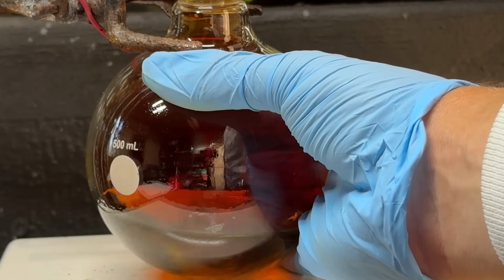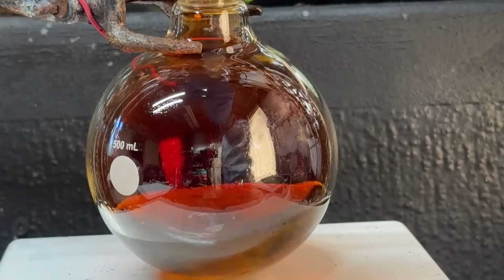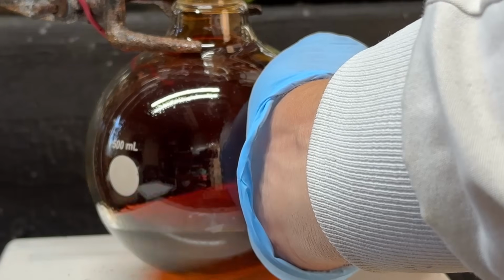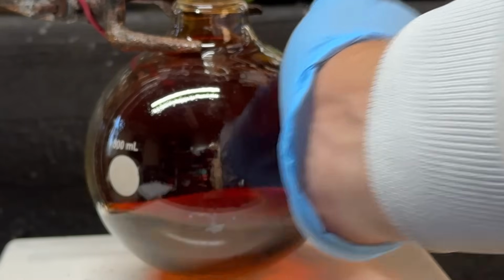You can feel that it's definitely starting to heat up a bit, and you can see by the more nitrogen dioxide coming off, that's due to the oxidation. So I'm going to cut down the isoamyl alcohol and let that stir a bit and just make sure it doesn't get too hot. Because if it gets too hot, you can easily have a runaway oxidation, and that will not be good.